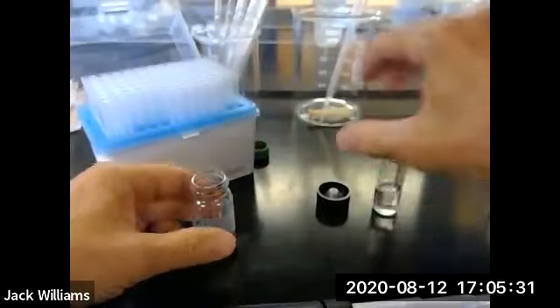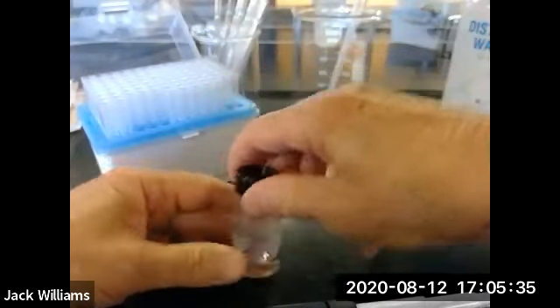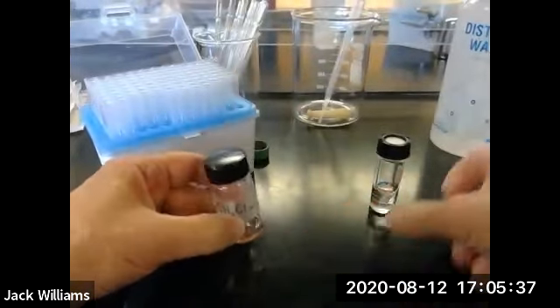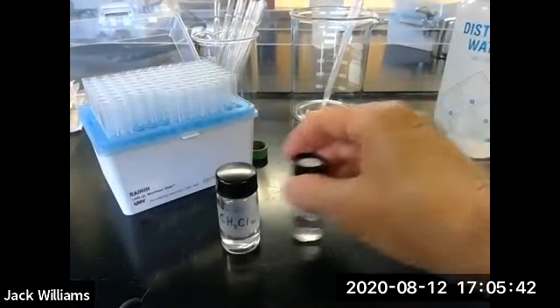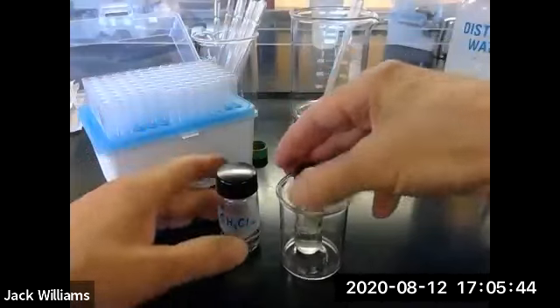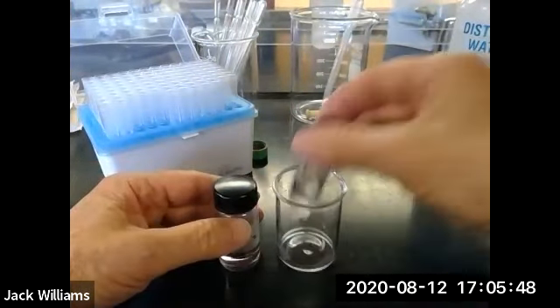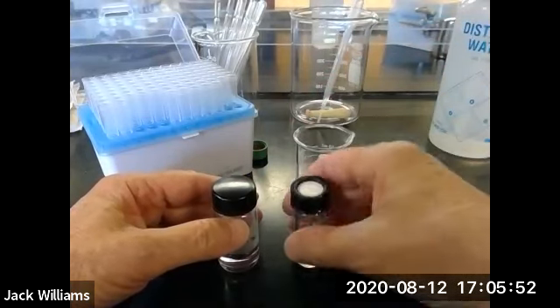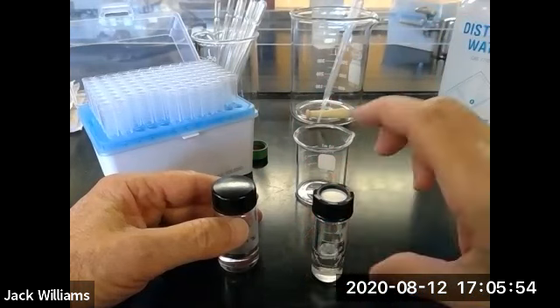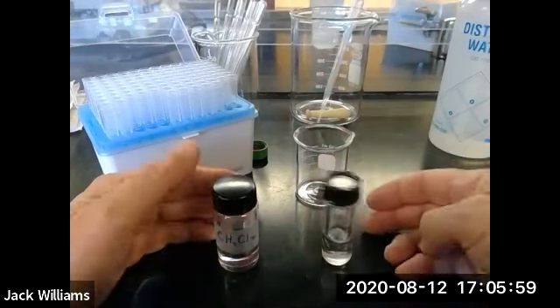And of course, the lid on the reagent. You could also put this conical vial into a beaker like this and transfer it. I guess it's up to you. It shouldn't tip over. Now, there are some cases in which we use a much thinner vial, in which case they're tall and you might run the risk of it tipping over, but you shouldn't have any problems with this.